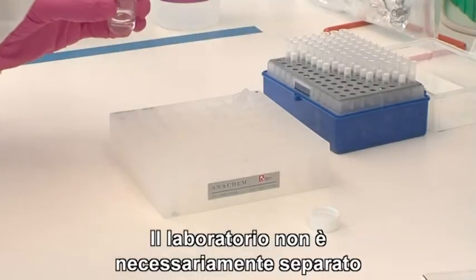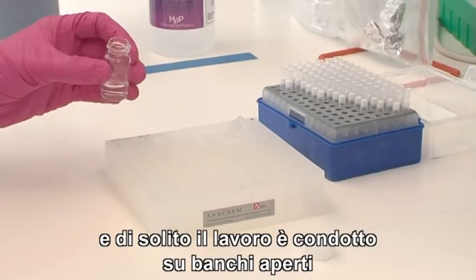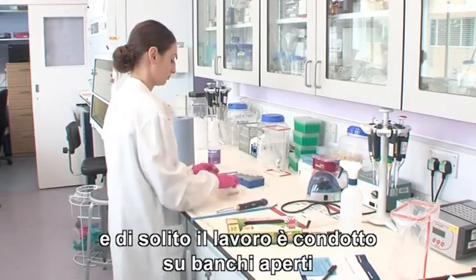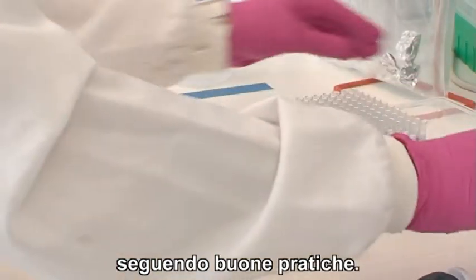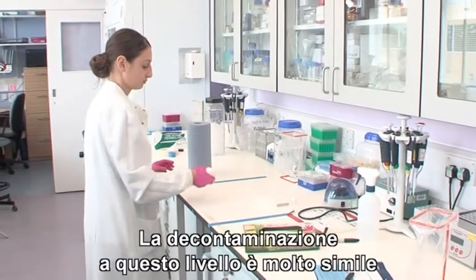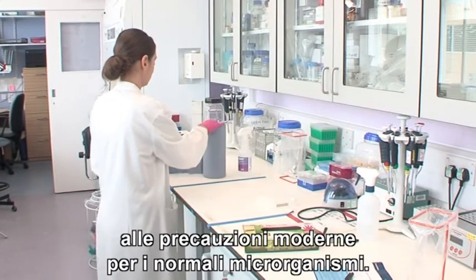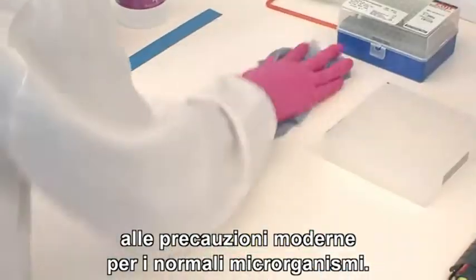The laboratory will not necessarily be separated from the rest of the building, and the work is generally conducted on open bench tops using good laboratory practices. Decontamination procedures for this level are similar in most respects to modern precautions against everyday microorganisms.